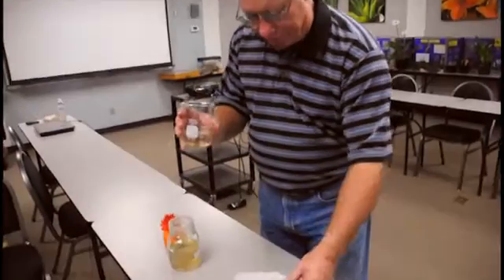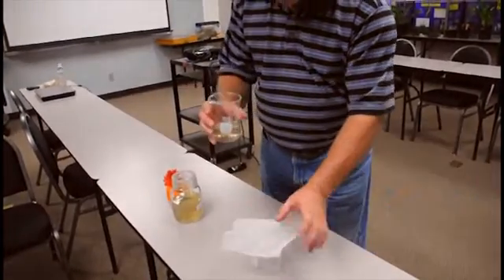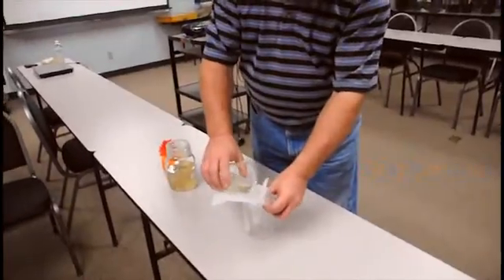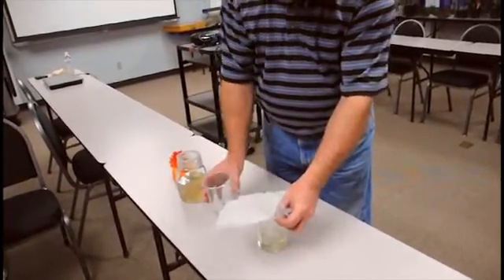And then what you want to do is put that over the funnel so you have the screen over the funnel and then go ahead and pour the solution through the screening material. And by doing that, you have now sifted the insects off.